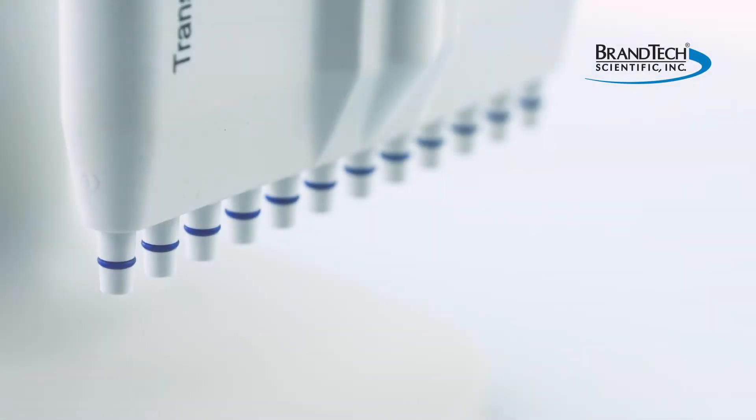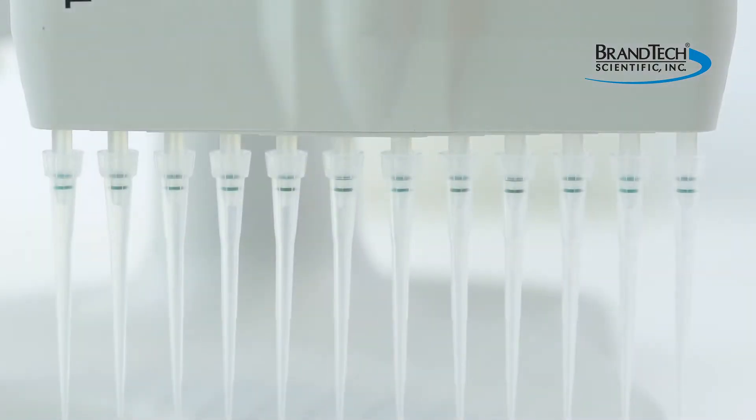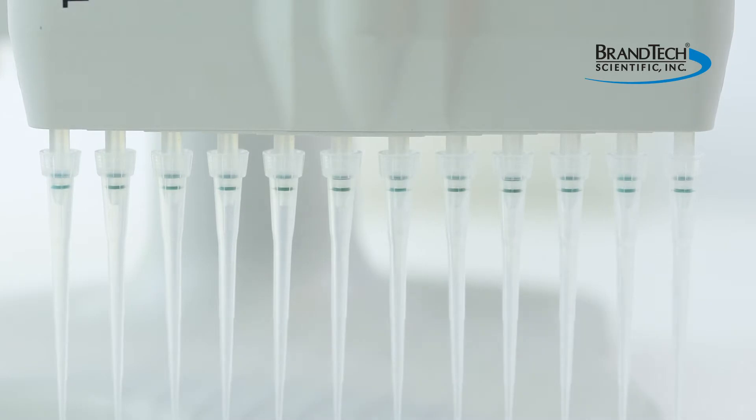Transferpette multi-channels that use 200 or 300 microliter pipette tips have a single O-ring design, while pipettes that use ultra micro or crystal pipette tips may have a single or dual O-ring design.